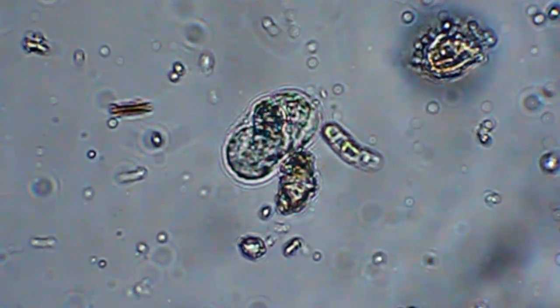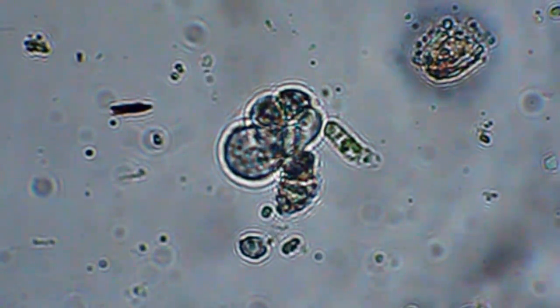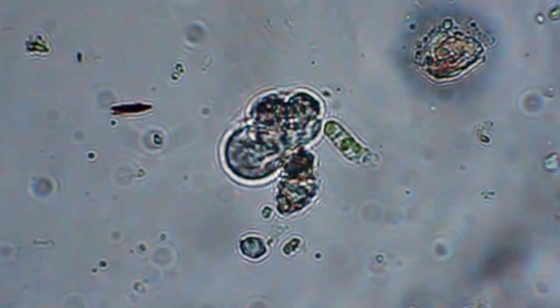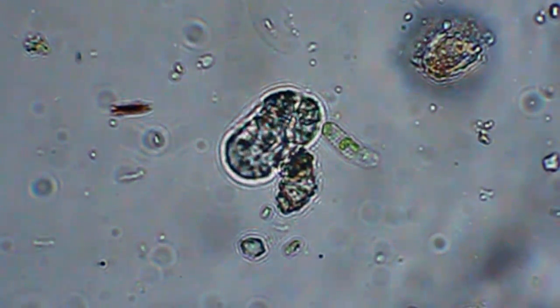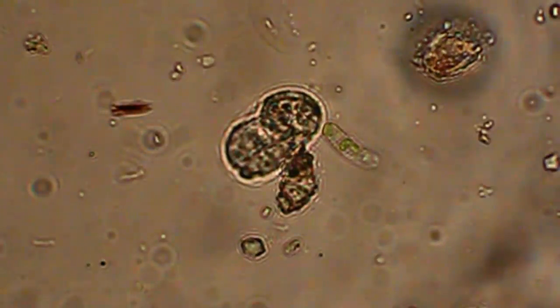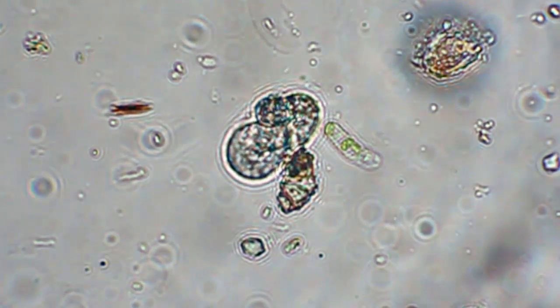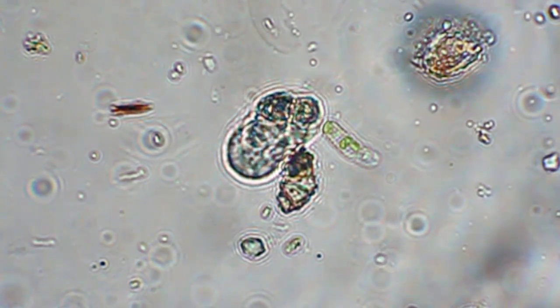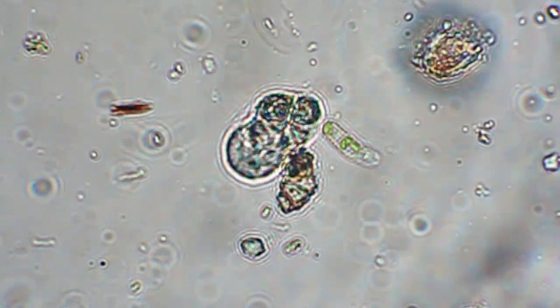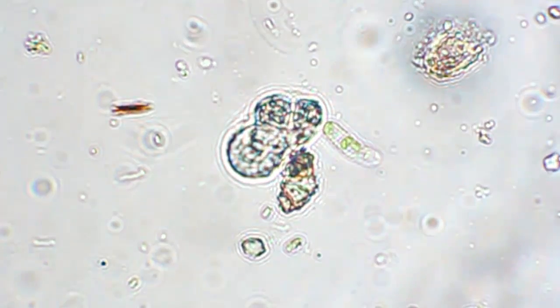This new Fluophot's got so many gizmos to turn and use and put in and out. Let me turn down the light intensity and get rid of that filter. Maybe this will help — close the field diaphragm a little bit, open up the condenser iris.